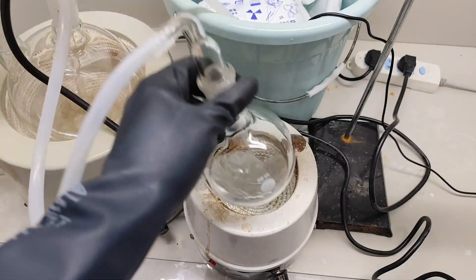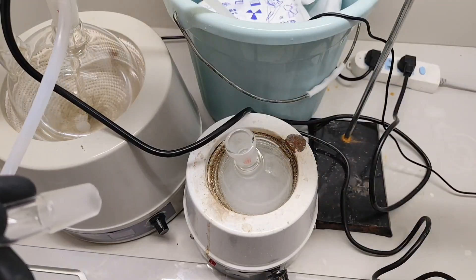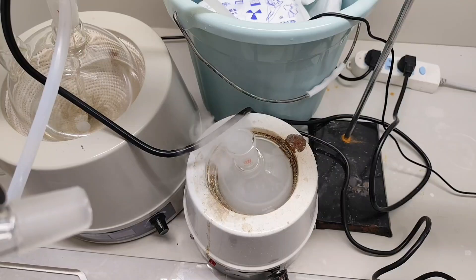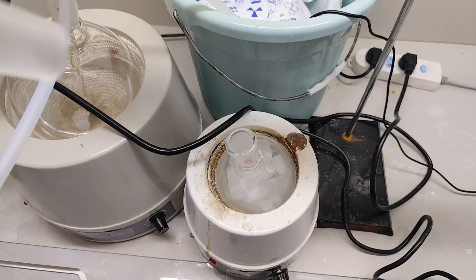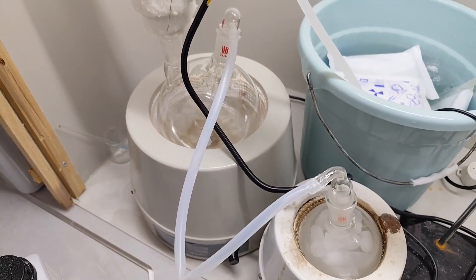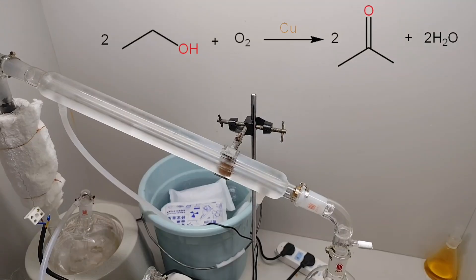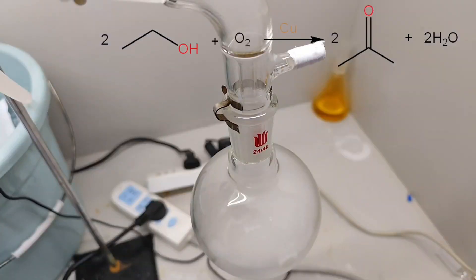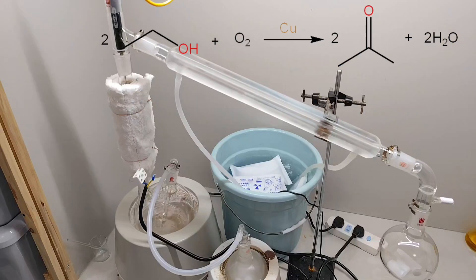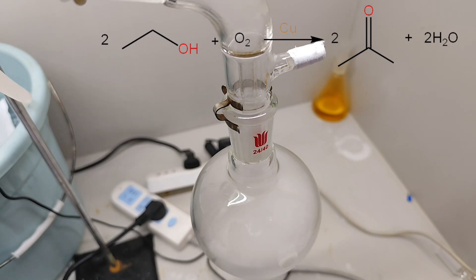In most cases, ethanol vapor is diluted and carried by nitrogen or argon. Since those gases were not available in my laboratory, I ordered dry ice and used carbon dioxide instead, which works fine. If CO2 is still unavailable or too expensive, simply using air is also acceptable. With air, the reaction changes accordingly — it becomes more convenient because it is exothermic, meaning no electric heater is needed. The only drawbacks are that the yield drops to about 40% and the mixture is potentially explosive, so be careful with the air pump.